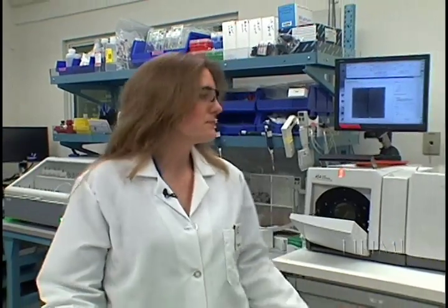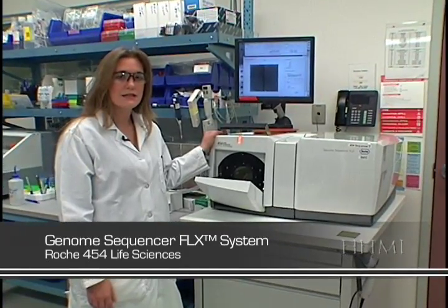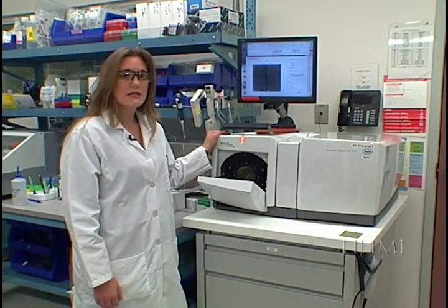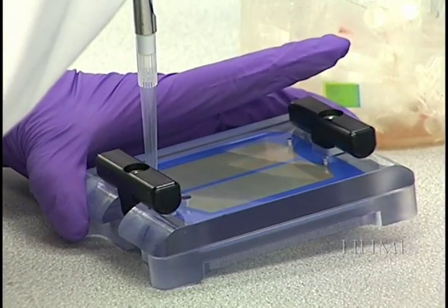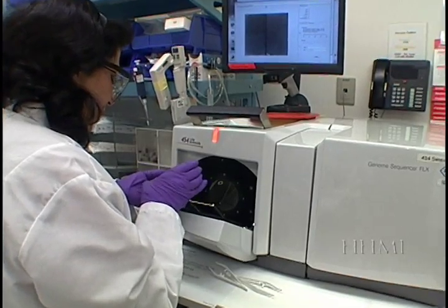Here at the JGI we are always looking to evaluate and incorporate new technologies. This instrument is a Genome Sequencer Flex System from Roche 454 Life Sciences. We have currently evaluated and are incorporating it into our production line. This instrument uses a process called pyrosequencing — a method of DNA sequencing based on the sequencing-by-synthesis principle that utilizes a chemical light-producing enzymatic reaction for detection.